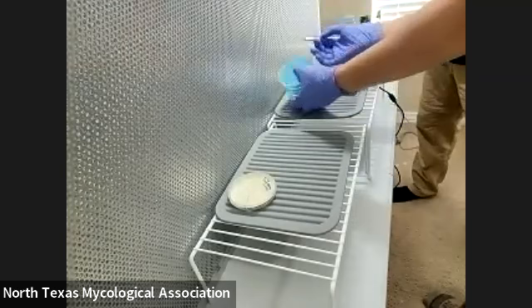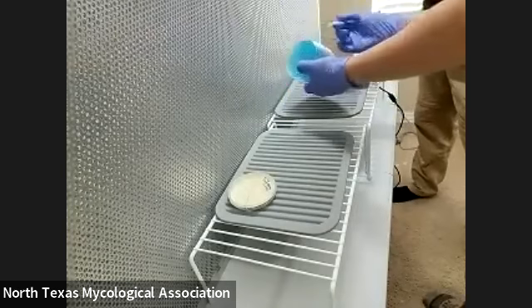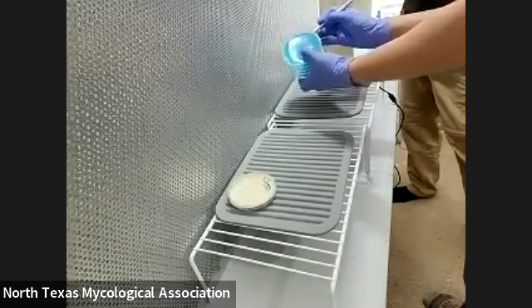I'm not going to explain much about this just because we're going to have the plates all wrapped up individually so they can use them easier. Will you share the recipe for the agar? Yeah, I'll write it on the PowerPoint.